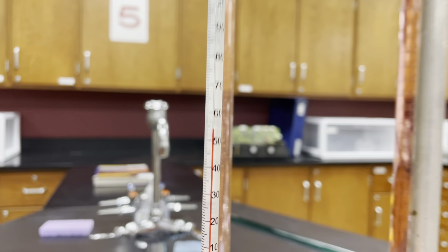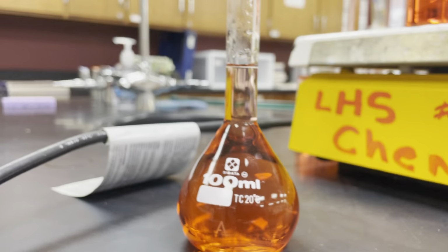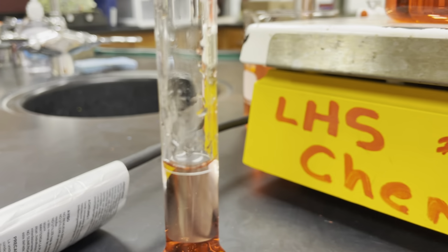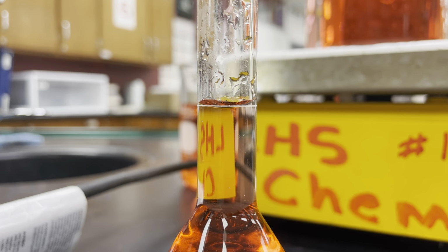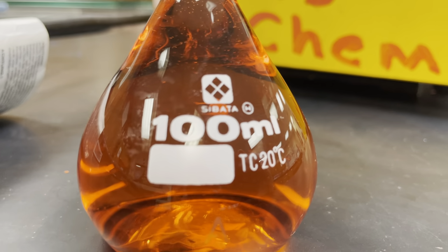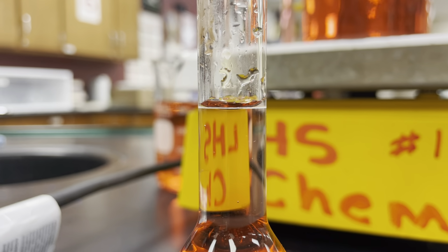Okay. Now, there is another kind of glassware I want to talk about, which is this guy. This is a volumetric flask, and you might also come across volumetric pipettes that don't have any other lines except this one line. That one line has a very specific purpose, and that is to tell us when we have exactly the volume written on this glass. Right now, this is TC for to contain 100 milliliters. And this line is meant to show exactly 100 milliliters of volume.